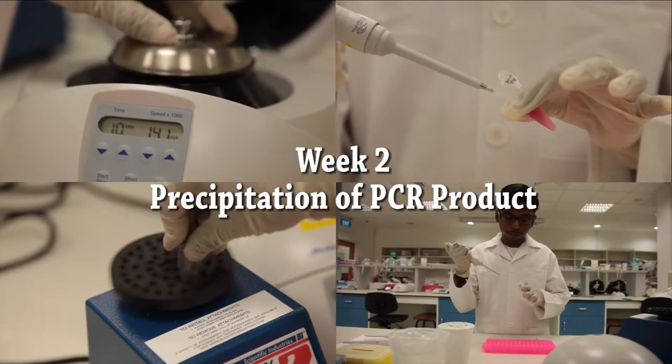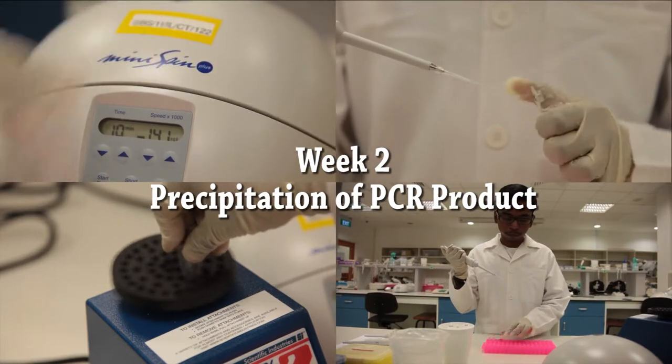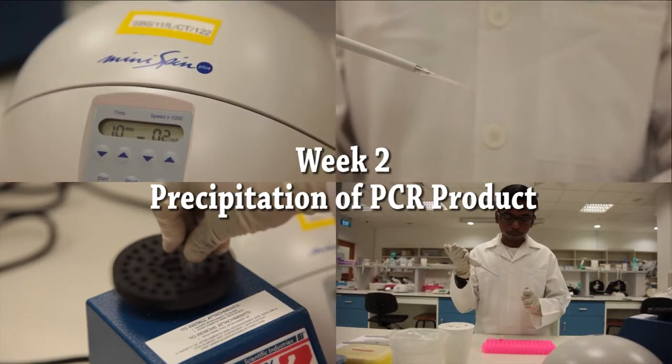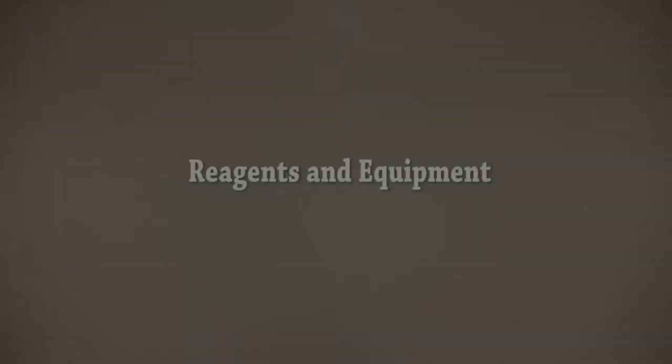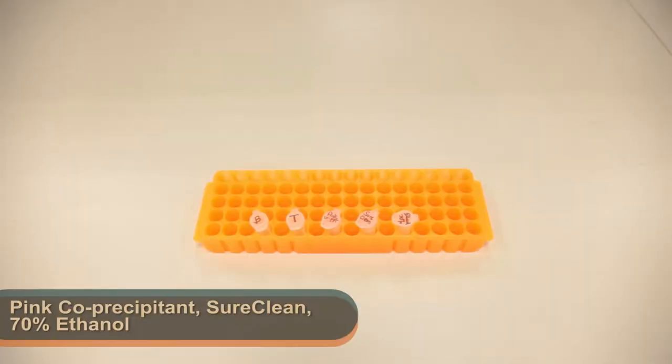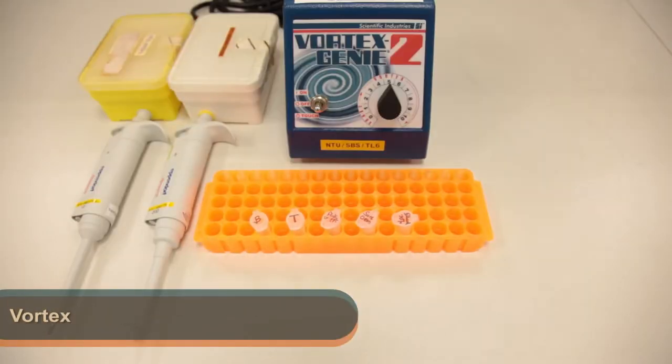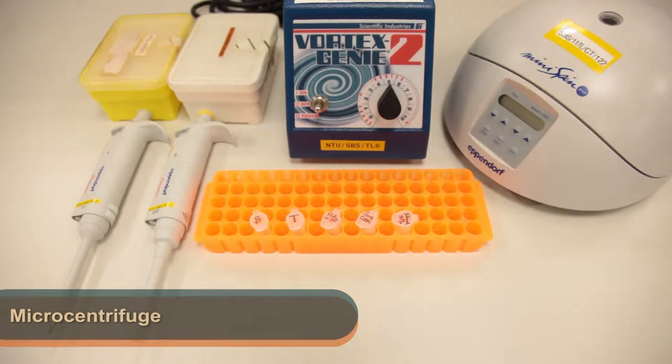In part two of this experiment, we will be precipitating the PCR product from week one. These are the reagents and equipment needed. Do check if you have everything before you start.